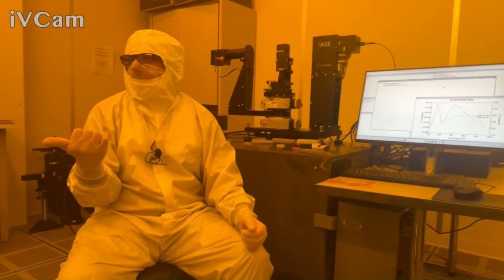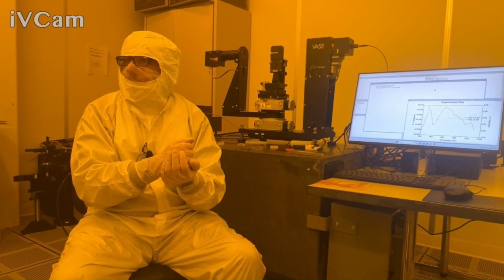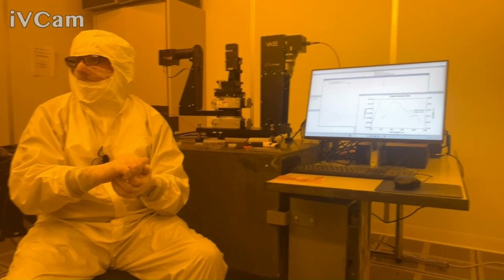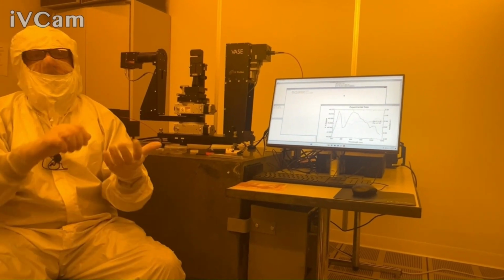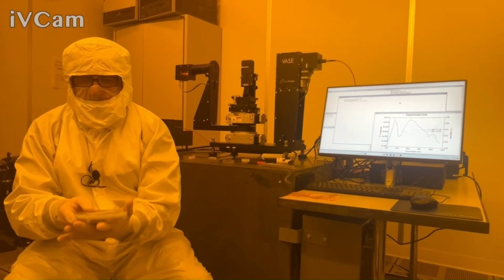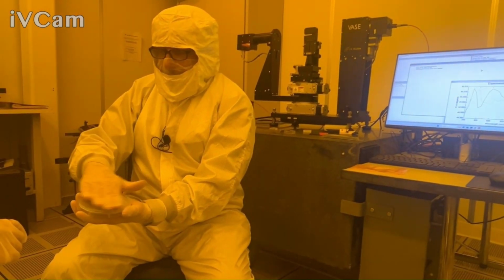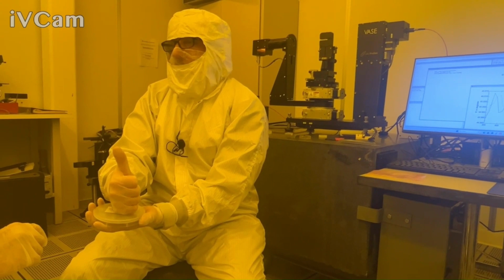And some of yours was anisotropic, I think, but it was uniaxial. Does that make sense? Mm-hmm. Not ours. No, your porous samples were not. They didn't show any anisotropy? Anisotropy in terms of what? The refractive index was different, so the in-plane versus the out-of-plane. Basically, if this was your sample, sometimes they would exhibit uniaxial anisotropy. So the refractive index in the plane, X and Y, would look the same, but that would look different from Z. Yeah, maybe it is.